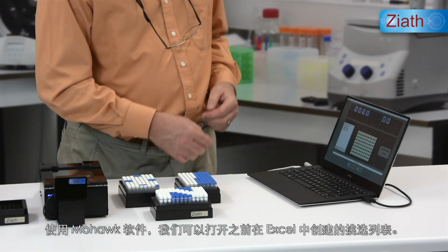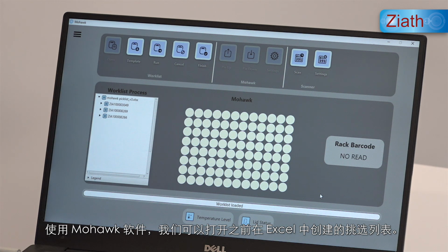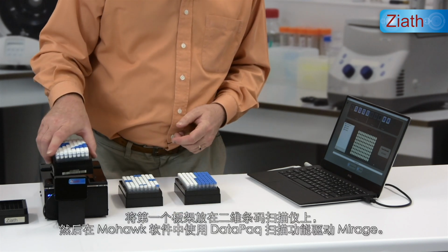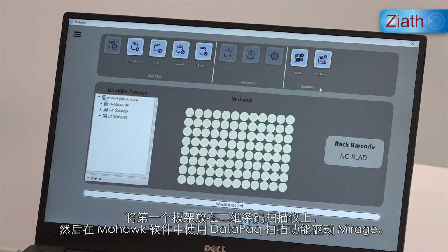Using the software, we can open a pick list which has been previously created, and we can verify those tubes using the scanner. So if we place the first rack, then within the Mohawk software, we can use the DataPaq scan function to drive the Mirage.